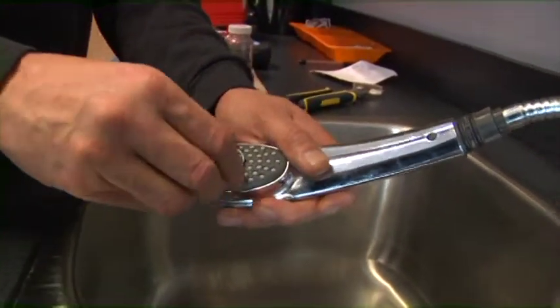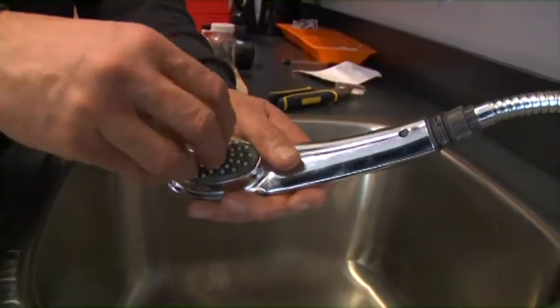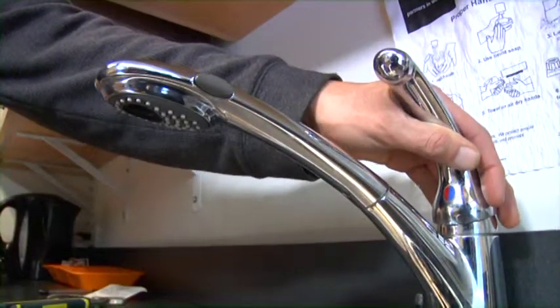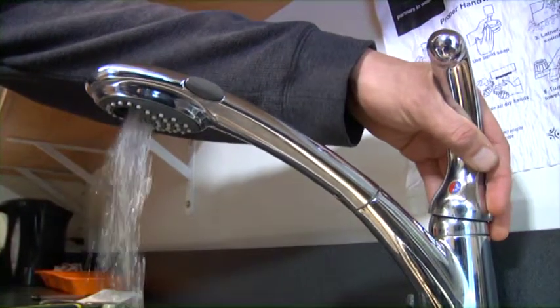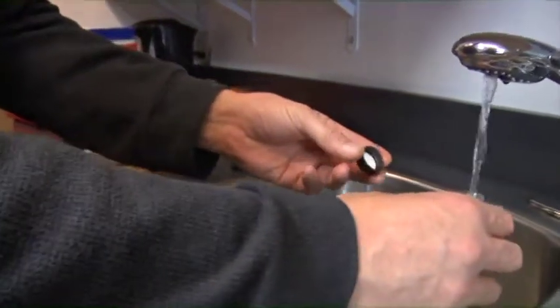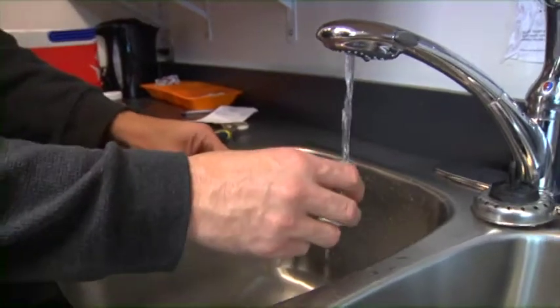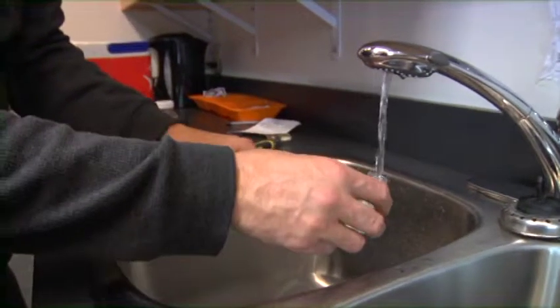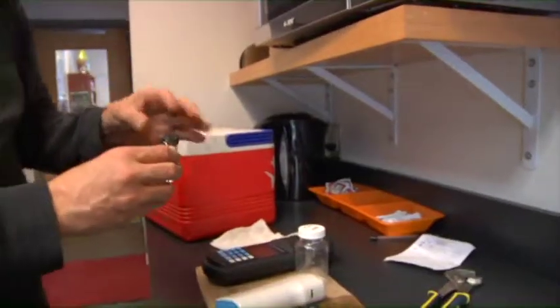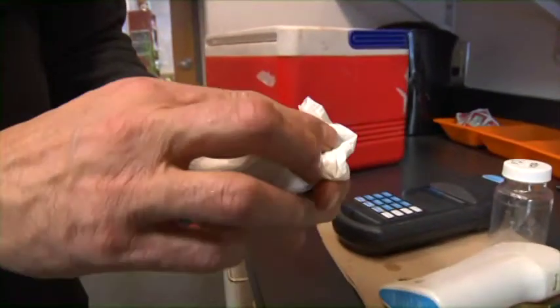If there is an aerator on the faucet, it is important to remove it prior to flushing the water line, as aerators can affect the quality of the samples taken. Run the cold water for a few minutes to flush the line. Then, for the chlorine analysis, take a sample bottle, empty it, and rinse three times. Then fill the test bottle to the 10 mL line with water and put the cap on. This is now called the blank.